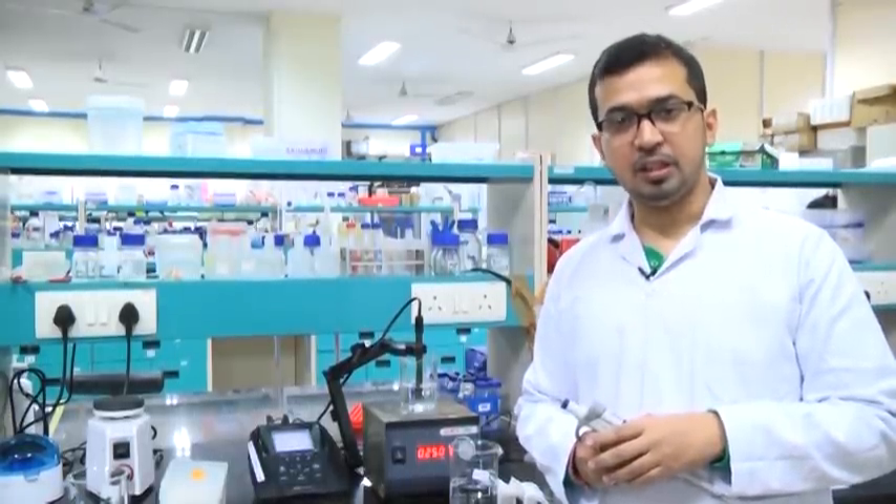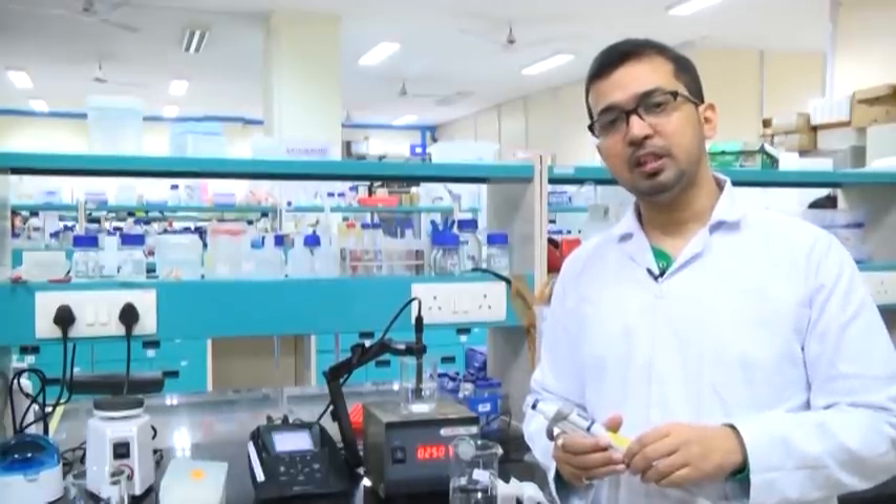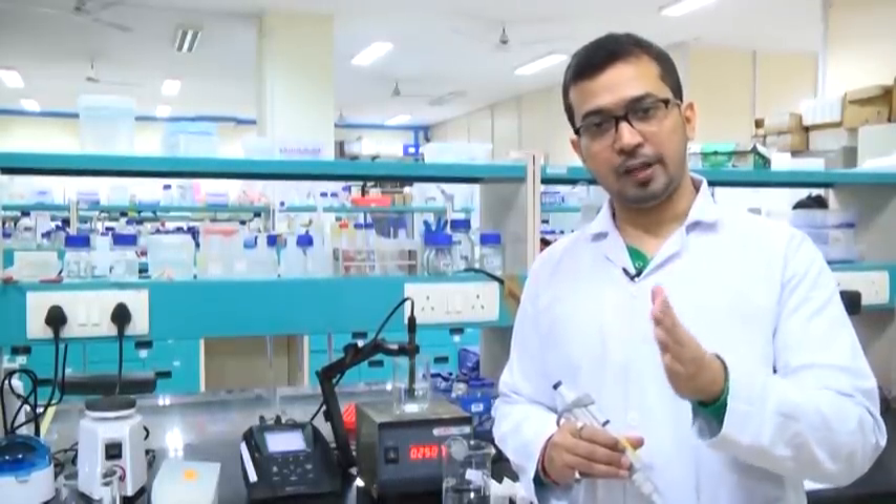We have prepared two different solutions — sodium hydrogen phosphate monobasic and dibasic — with two different pH values: around 9 for the dibasic and around 4 for the monobasic. Now we will proceed with preparation of phosphate buffer at pH 7.4. The concentration for both components is fixed at 0.1 molar or 100 millimolar.